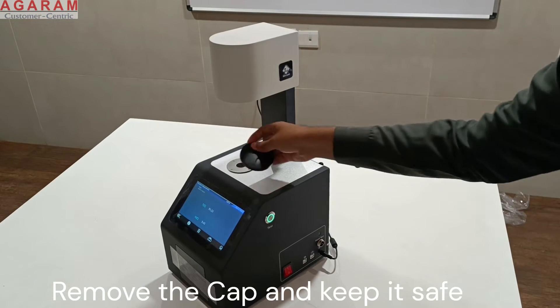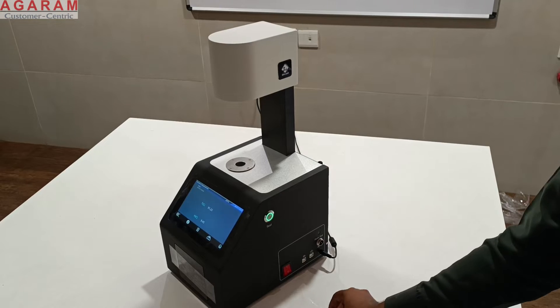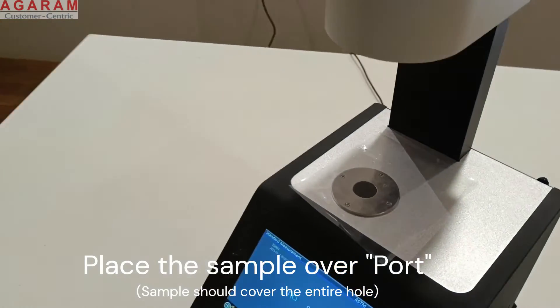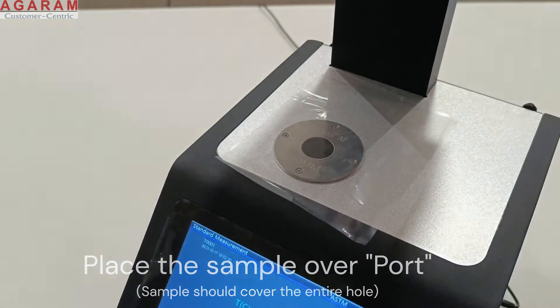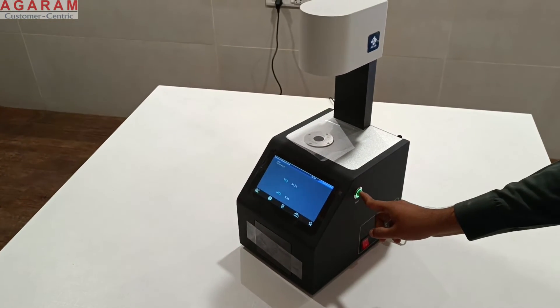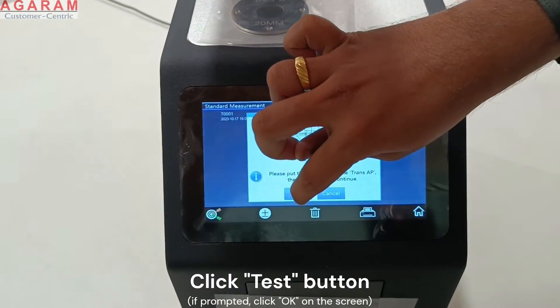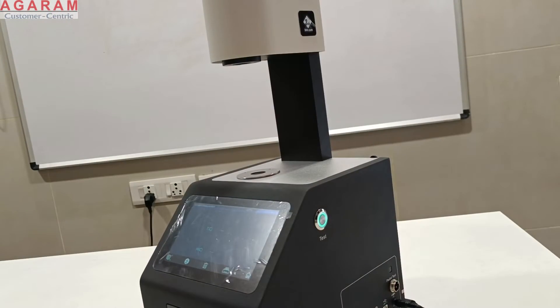Remove the cap and place your sample on top of the measuring aperture. Ensure that the sample is flat and it fully covers the measuring port. Now click the test button and if prompted on the screen press the OK button. Wait for up to 5 seconds for the measurement to be complete.